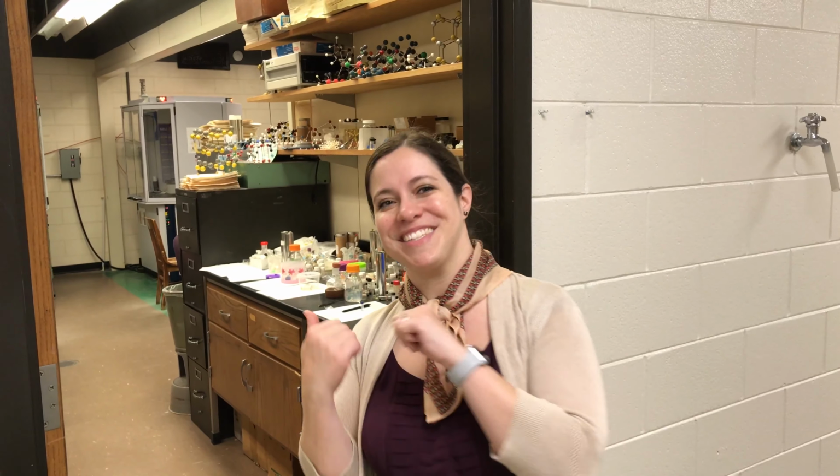He's had 3,300 entries into their database since 1975. The biggest year he had was 465 entries in 1 year. In that same year, he published 384 articles. So a really, really big person in the crystallographic universe. In fact, so much so that they even nicknamed his 1000th molecule that they submitted as the CSD man. So without further ado, let's go in.